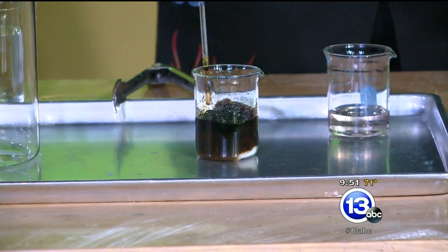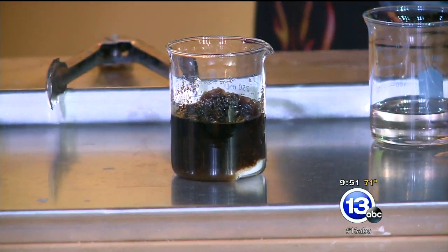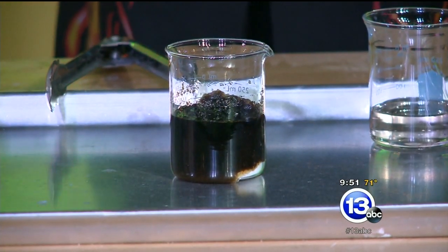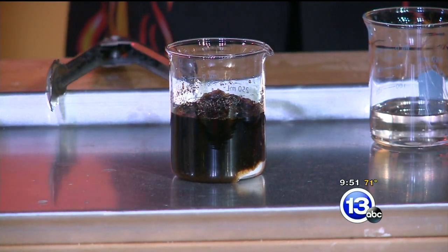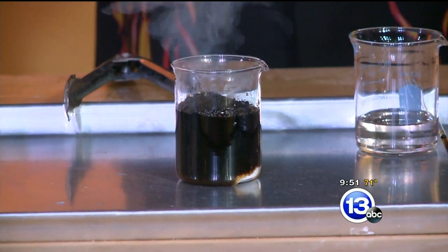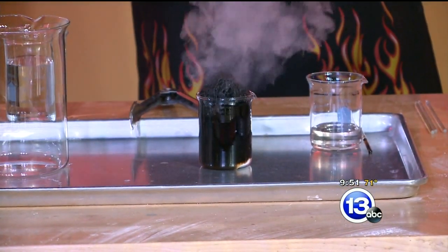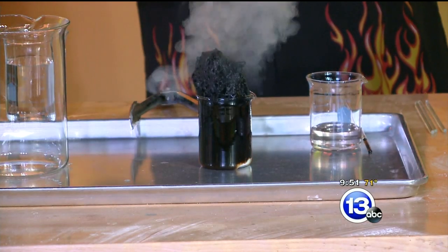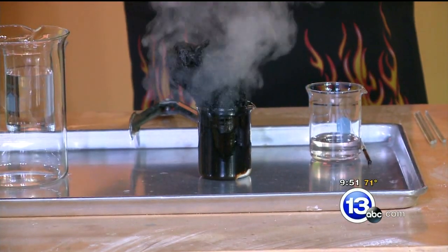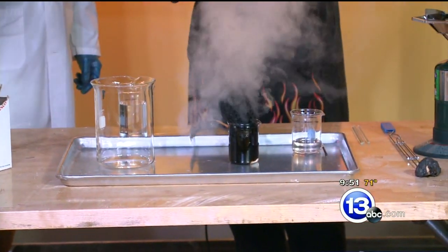In a few seconds you're going to see some bubbling action happening on the top. If you look closely, you can see it's kind of bubbling. That sulfuric acid reacting with the water and the sugar — once that acid gets hot enough, it's going to start generating water vapor. You can see it actually expanding. There goes the steam. That vapor coming out could have a little bit of sulfuric acid in it, so we're going to try to stay away from that. What's happening is we're turning the sugar into carbon. We've got some water vapor in there that's generating little pockets. We're actually making a foam of carbon coming out here.